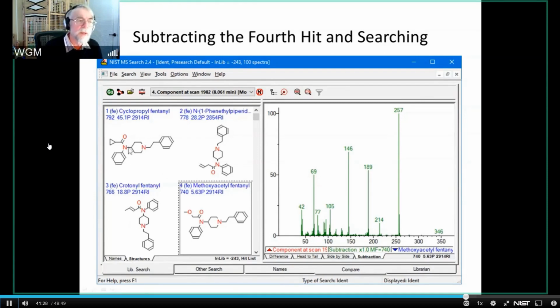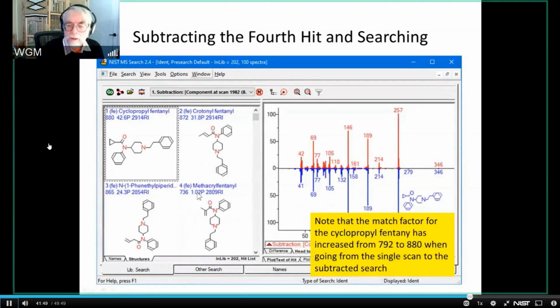I will tell you, because this was something that was made up, it happens to be this one. So this was an attempt to see how well we could do with a complex file like this. And someone made up a mixture of the cyclopropylfentanyl and the methoxyacetylfentanyl. So let me go back.